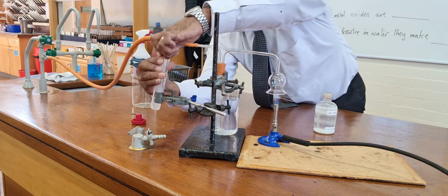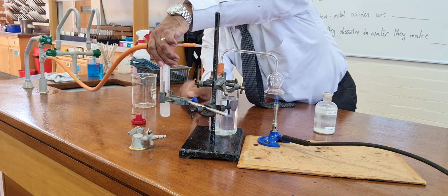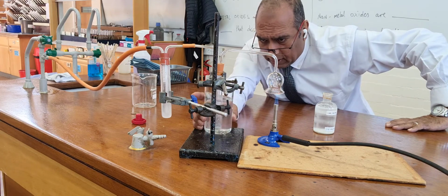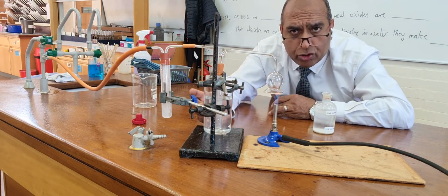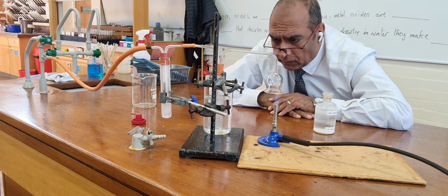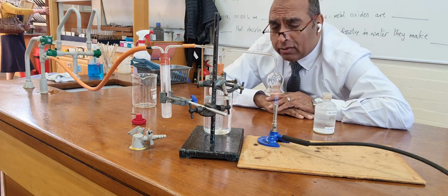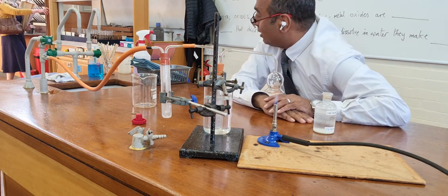And now if I put this back, because I need it back to give me the suction. So the suction happening here, I'm hoping I can show you that I've got drops of water collected. Now I can see I've got drops of water. I can see the condensation going on. However, have I got enough to show you? You'll have to wait and see.